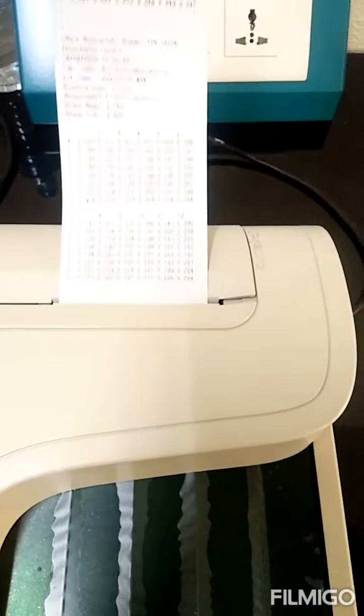So I've got my final absorbance also, 3 readings I've got. Using this, I'm going to plot the standard graph, and the unknown value I'm going to find out. How to plot a standard graph, all those things I've taught in the carbohydrate estimation video. Please do go and check those videos to get a rough idea how to plot a standard graph and how to detect the unknown values from the standard graph.